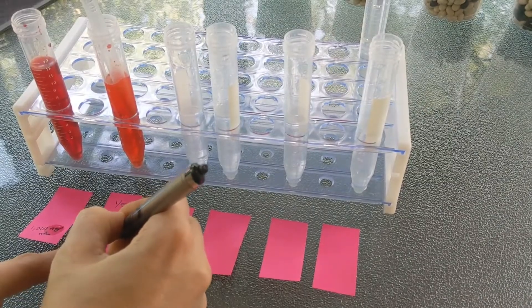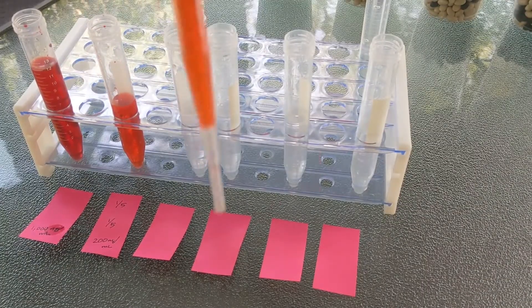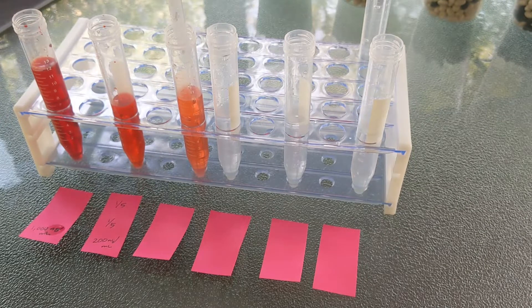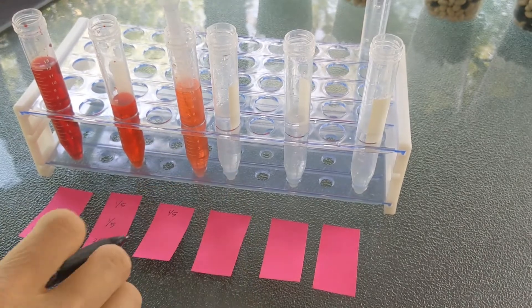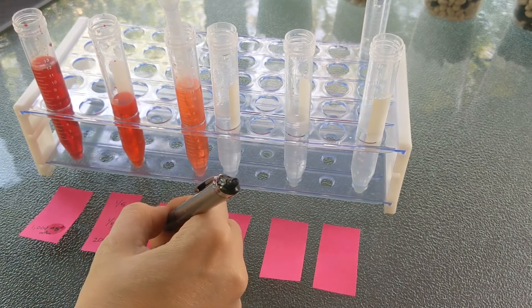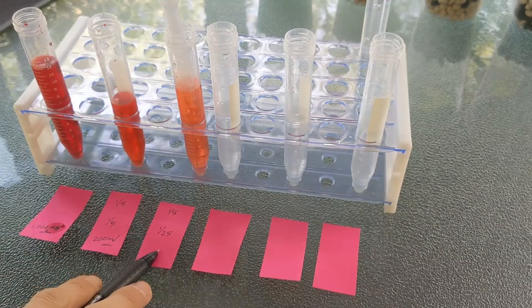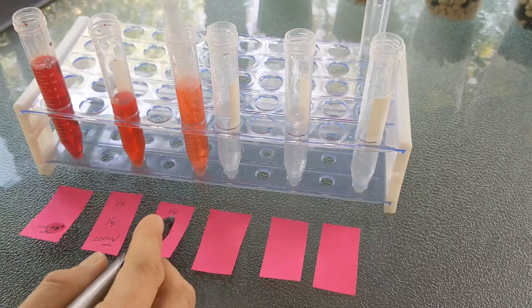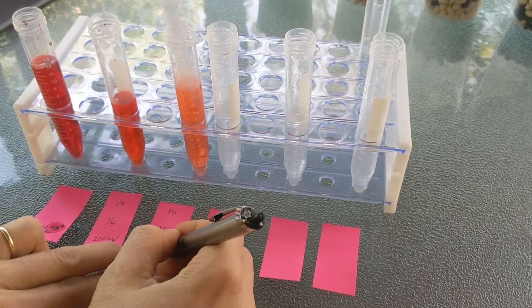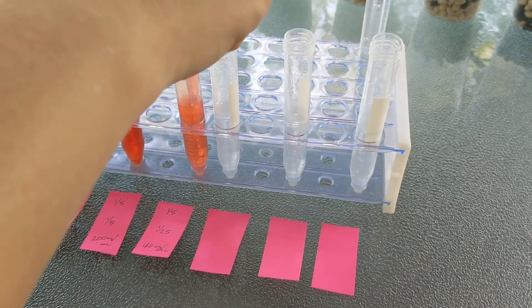Then I take 2 milliliters again and pipette that into the third tube — sometimes it's good to pipette up and down to mix. My tube dilution is one-fifth, but now that's one-fifth of what was already one-fifth, so we multiply fractions to get one twenty-fifth. You could do one twenty-fifth of 1,000, which is 1,000 divided by 25, or just do 200 divided by 5. I prefer to do that: 200 divided by 5 is 40. This tube has a concentration of 40 nanograms per milliliter. And if you're one of my students, I'm a stickler for units — you have to write it on each one.